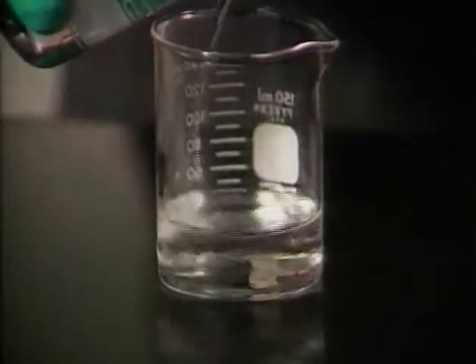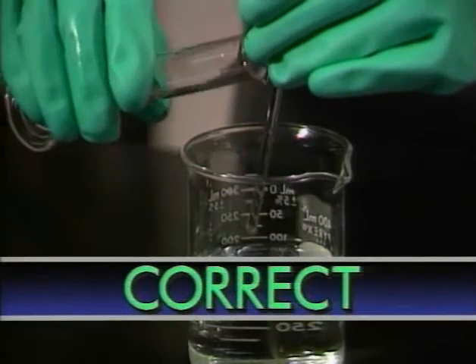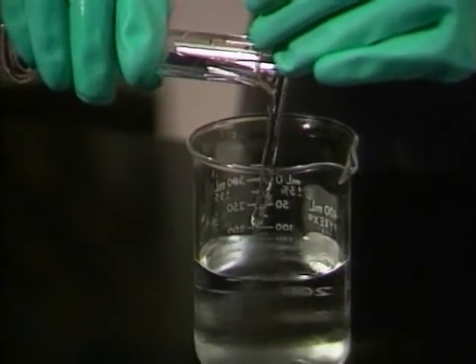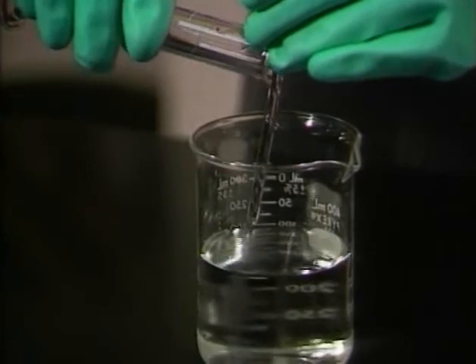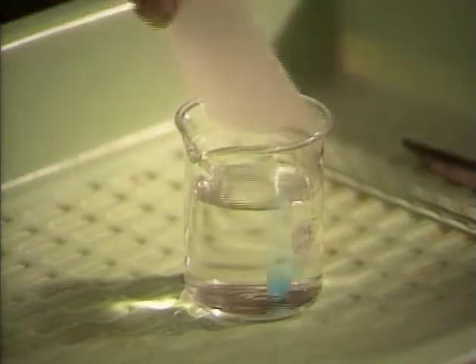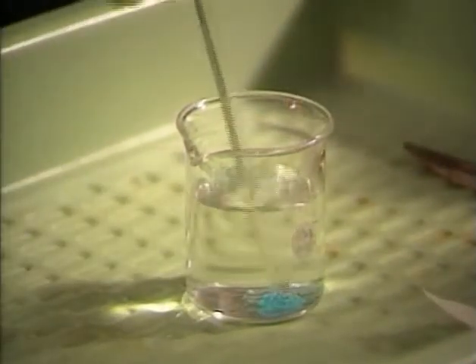This is water added to acid — the acid boils and it can splash out of the beaker. When acid and water are mixed correctly, there's less danger. Acid is poured from a graduated cylinder or beaker down a stirring rod into the water.